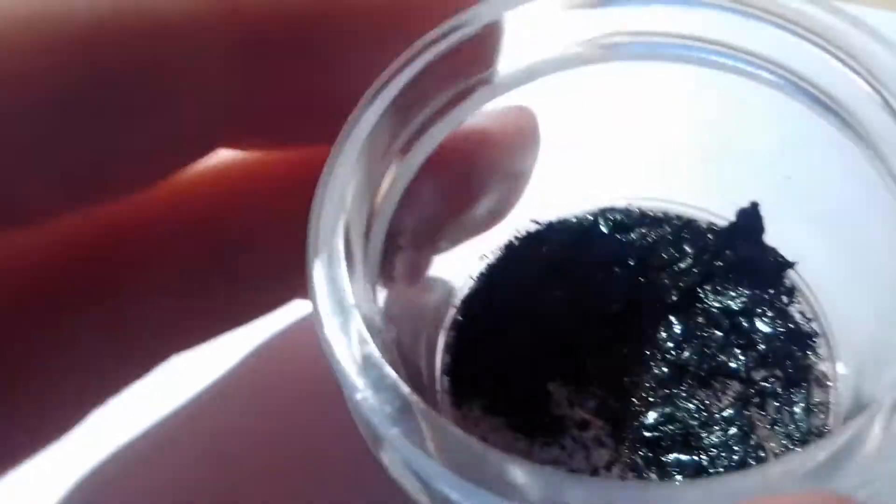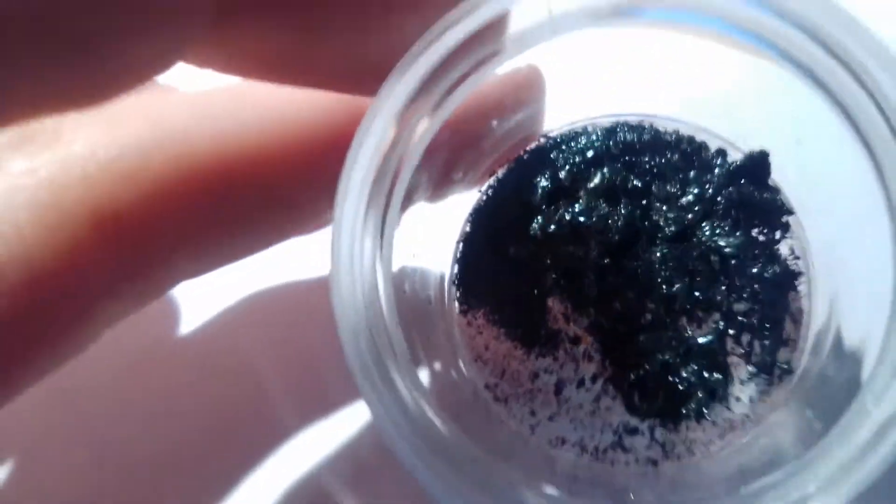This is what I got, about 2 grams which represents about 20% yield, which is honestly not that good.